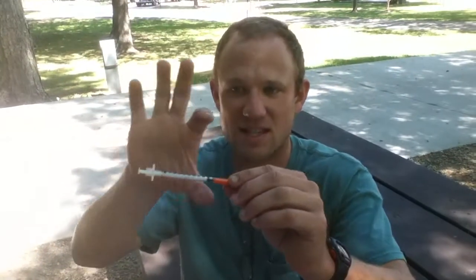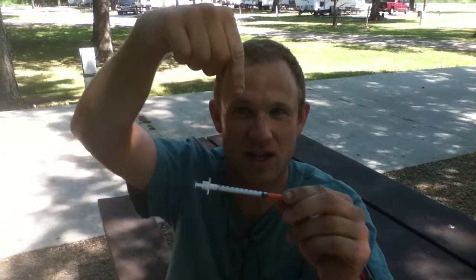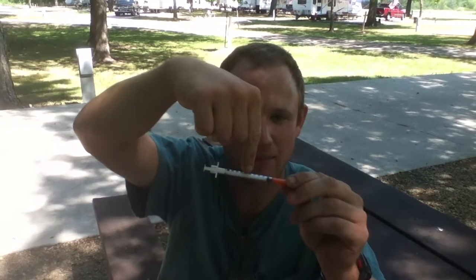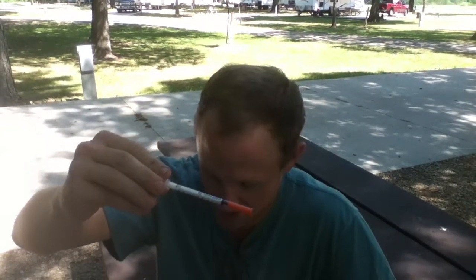If this is the tail and this is the backbone in the tail, just above the backbone is the caudal vein. What I try to do is insert my syringe down until I touch the top of the backbone, pull it back a little bit, and I should be in that flowing blood and be able to get my blood sample pretty easily.